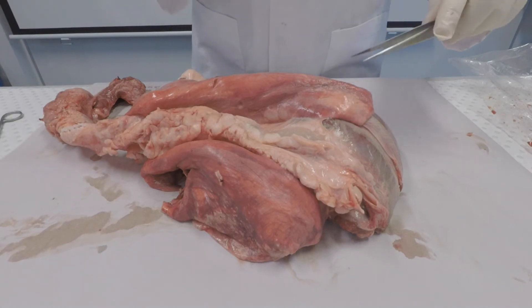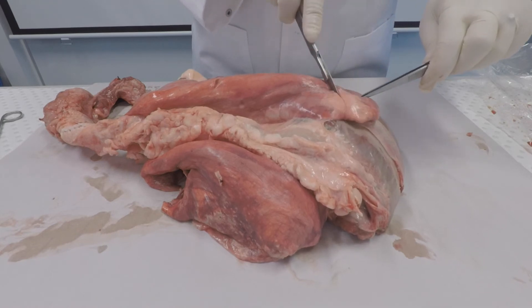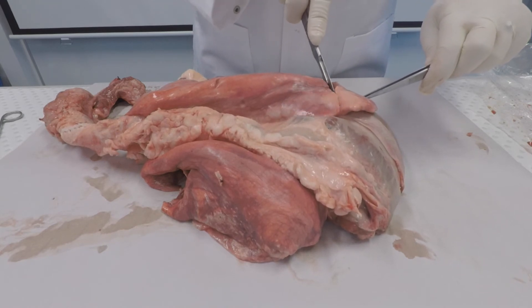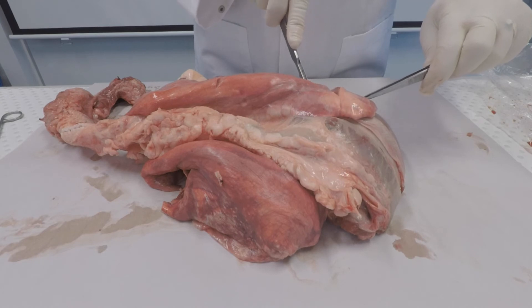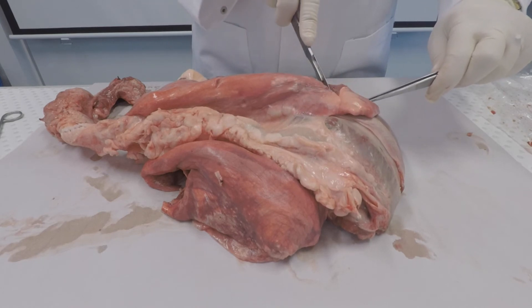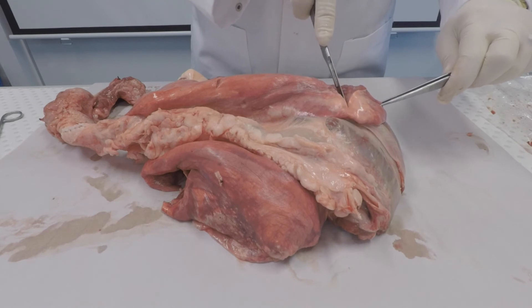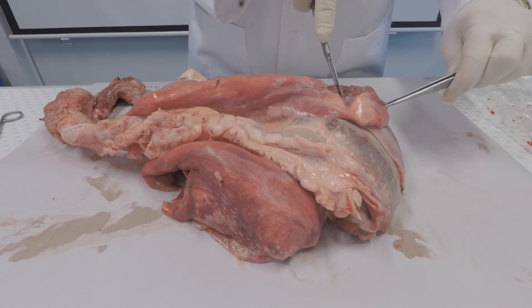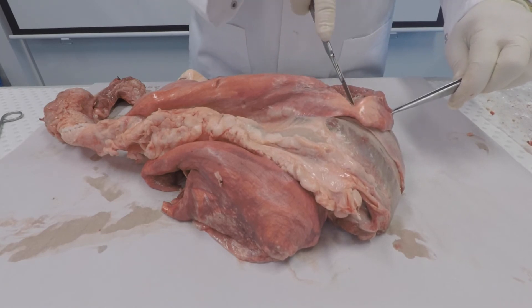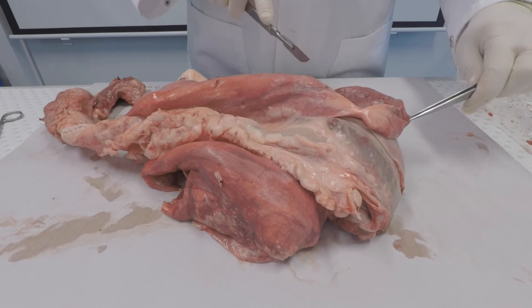So now I'm going to dissect the lung tissue open to show you the internal structures. The trachea branches off into primary, secondary, tertiary bronchi and then into terminal bronchioles.